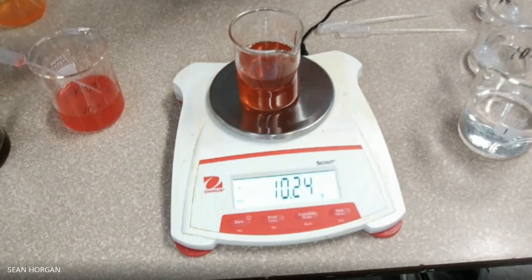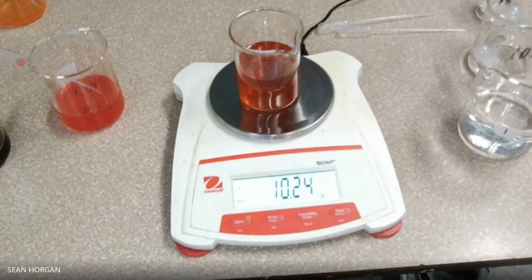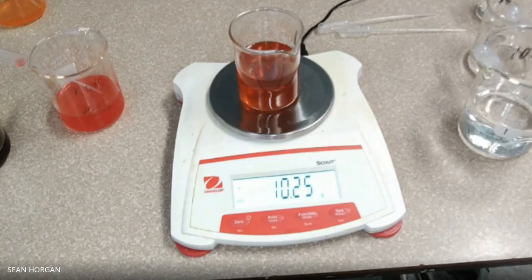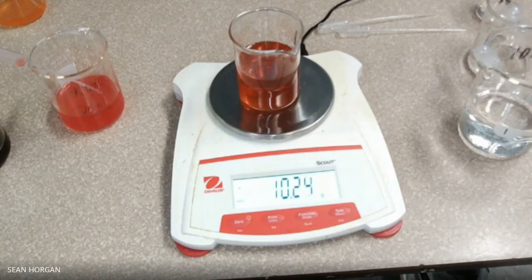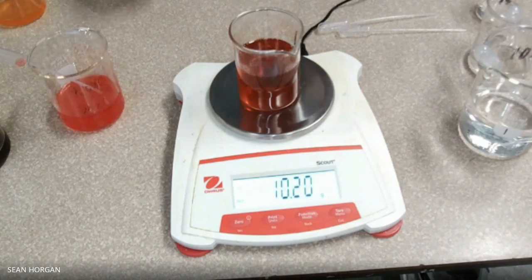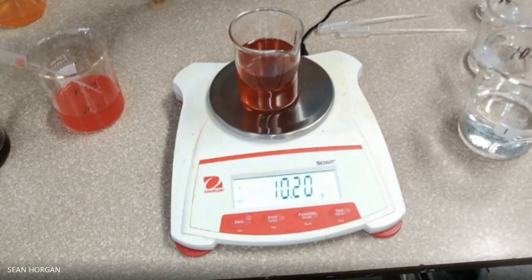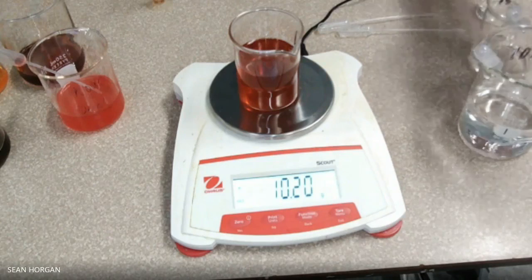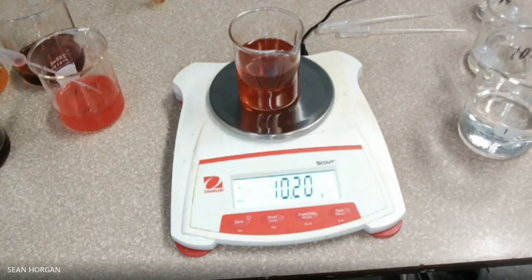And the last one, we have the grape juice. Got it right to the meniscus, drop it in. So we have three different unknowns, and we have the knowns, which are the sugar solutions — we know what percentage sugar is in those. We don't know what these are, but we're going to figure those out. And that is the Beverage Density Lab.